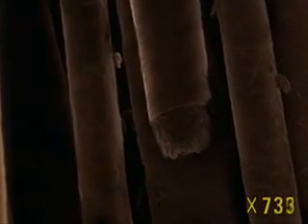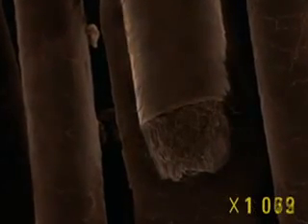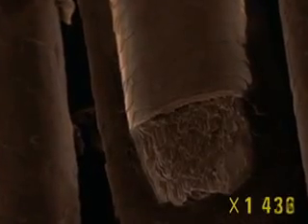As we look closer, the hair appears to have a double structure. The surface is protected by scales. Each scale is made of a series of flat cells piled five or six deep to form an envelope that protects the hair from damage.